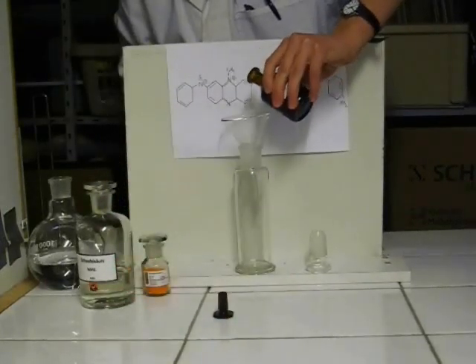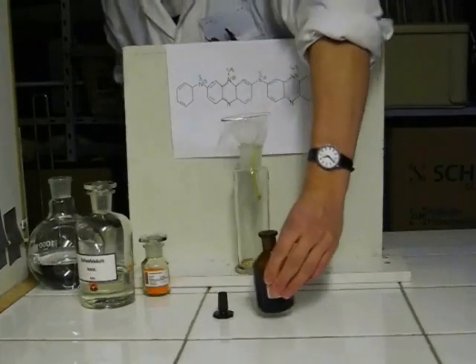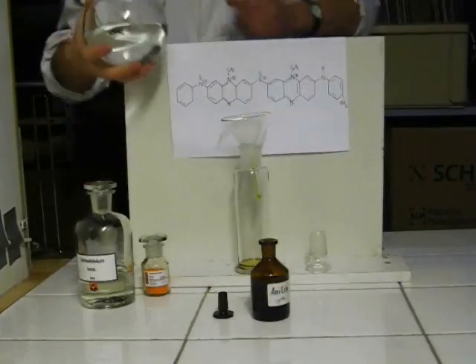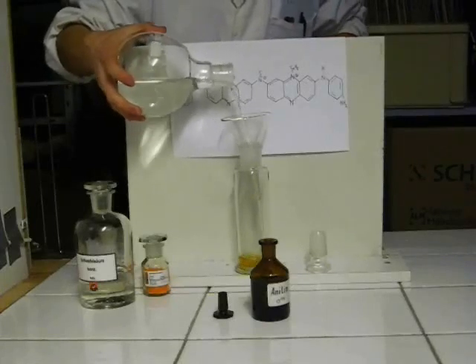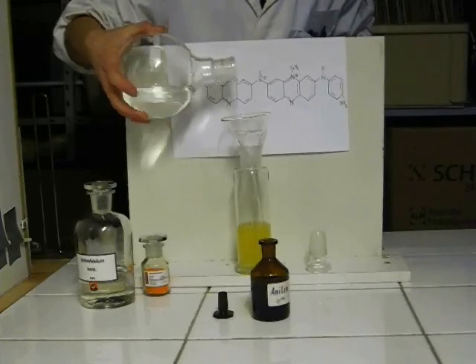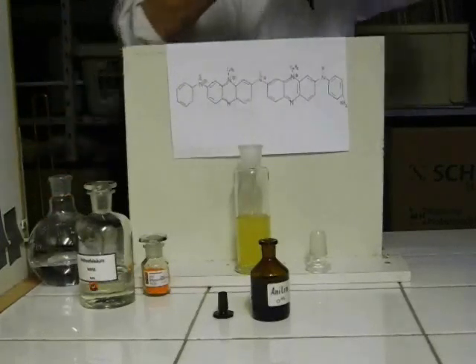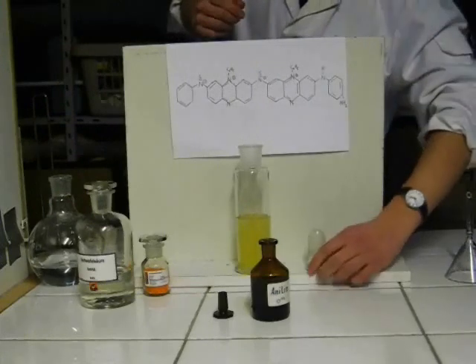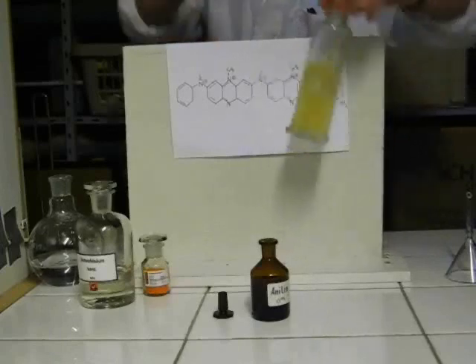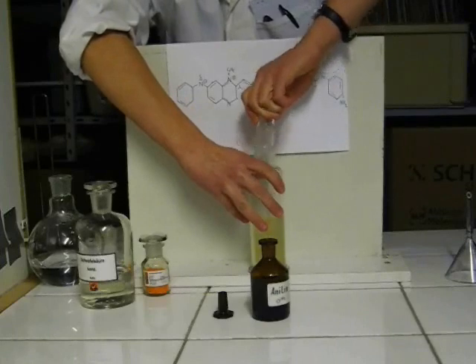The dye Aniline Black is formed by the oxidation of aniline with potassium dichromate and sulfuric acid solution. The aniline is first diluted and mixed with water, then acidified with sulfuric acid.